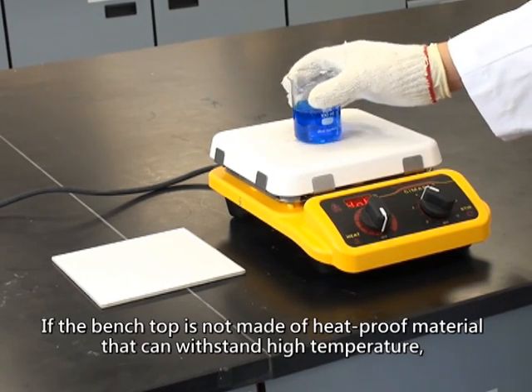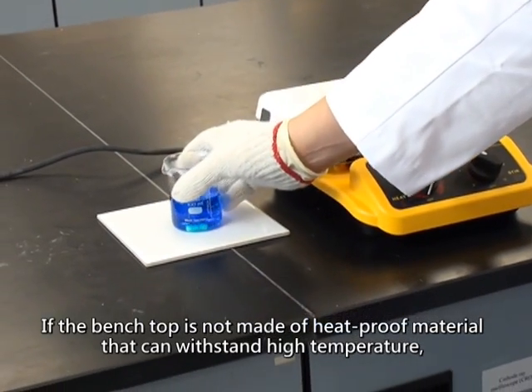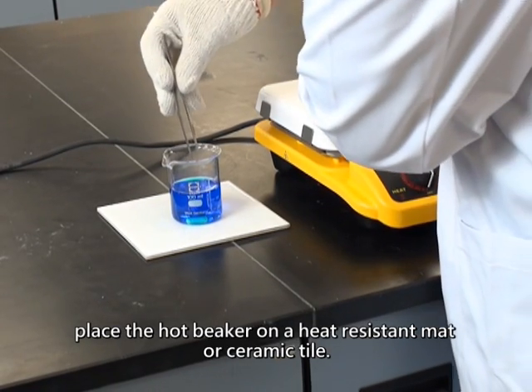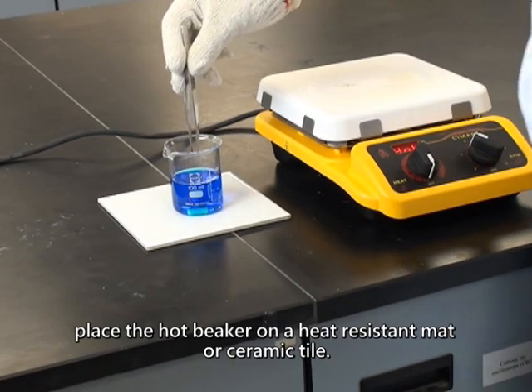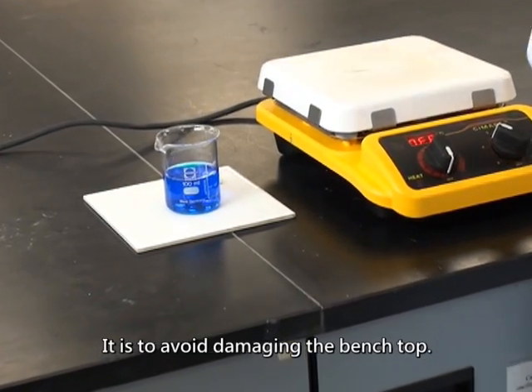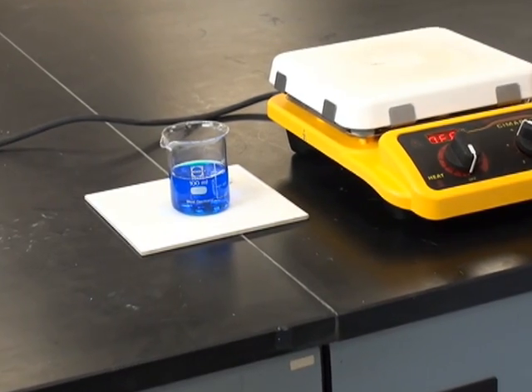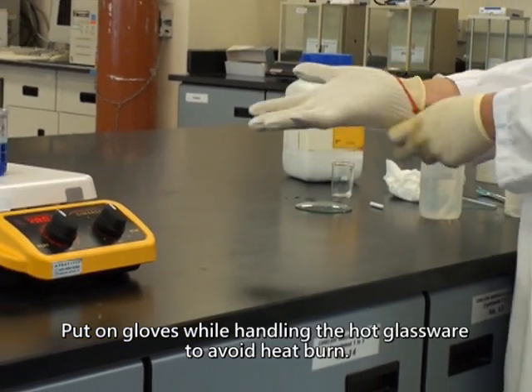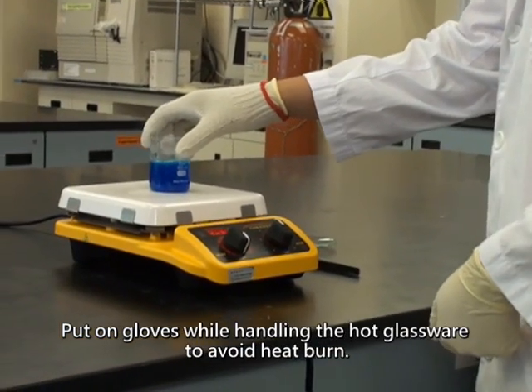If the bench top is not made of heat-proof material that can withstand high temperature, place the hot beaker on a heat-resistant mat or ceramic tile. It is to avoid damaging the bench top. Put on gloves while handling the hot glassware to avoid heat burn.